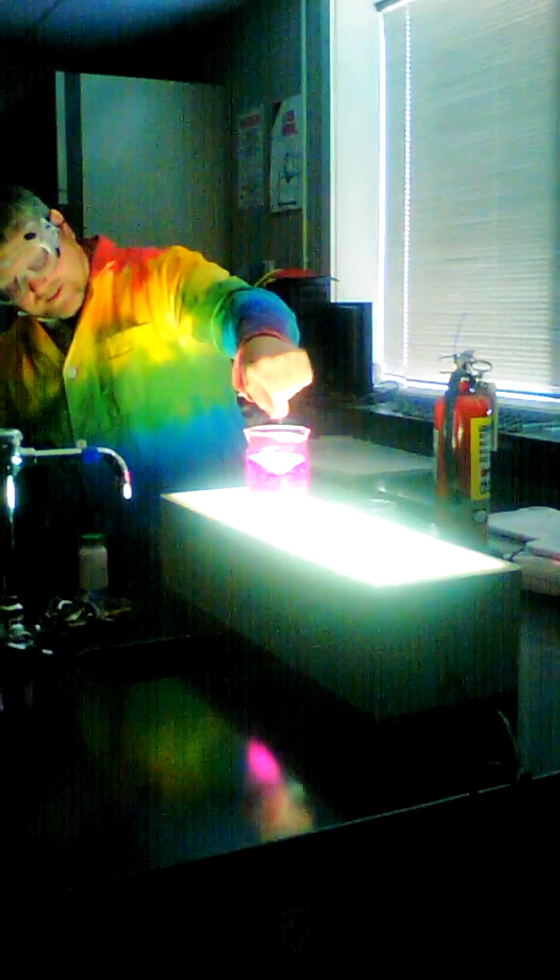It's really pink. Yes, it is. When it starts working, you'll know — it actually comes up to the top when it starts to react. It's not quite reacting yet. It's got a little reaction going, but it hasn't totally gone off yet. Wait until it actually happens.